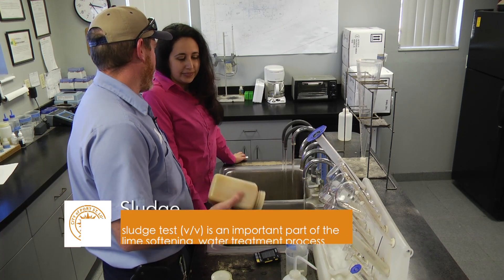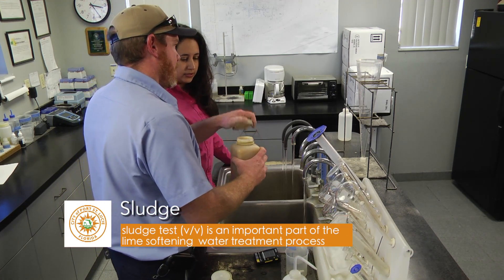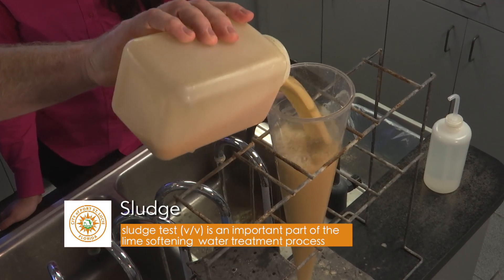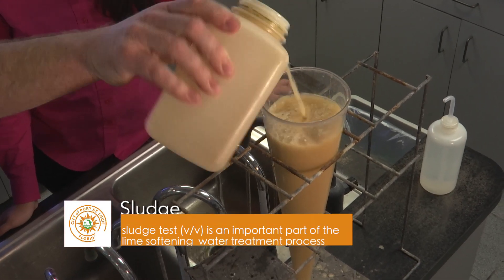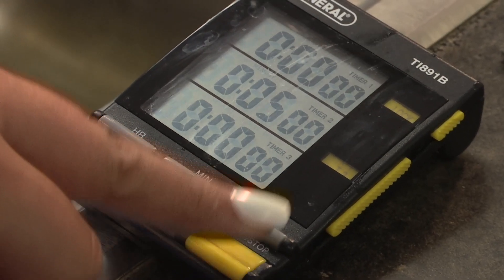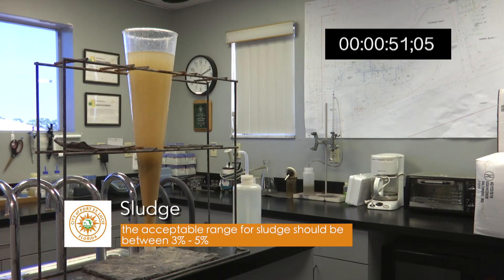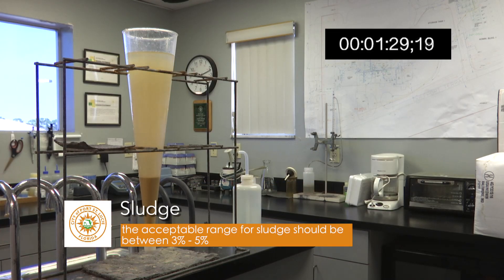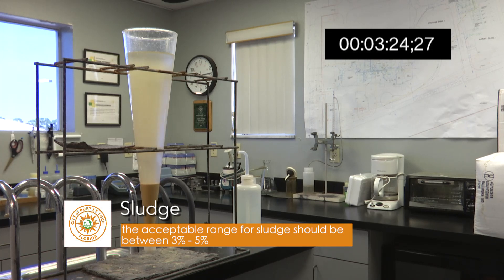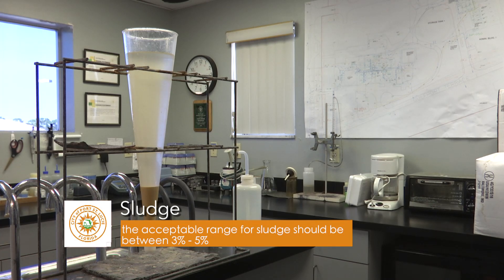Now we're going to run our sludge sample. We're going to dump this in to the 1,000 mil line and then we're going to start our five minute timer. That's going to settle out for five minutes and you'll see a clear difference of where the sludge and the water will settle, and that'll be our sludge level for our accelerator.